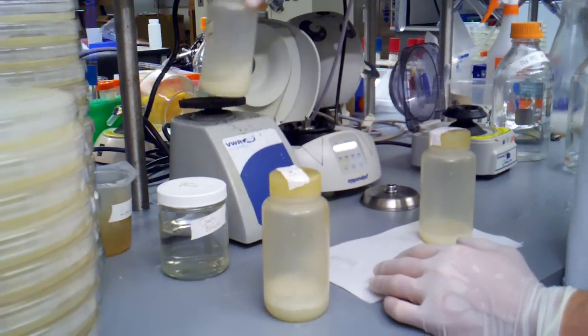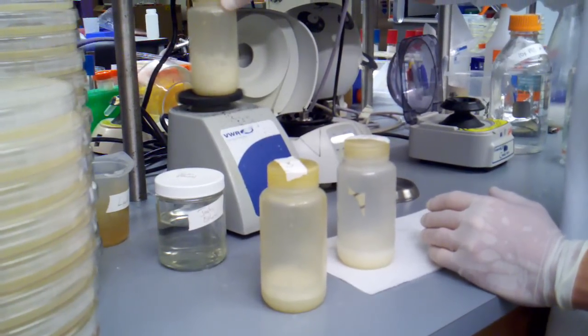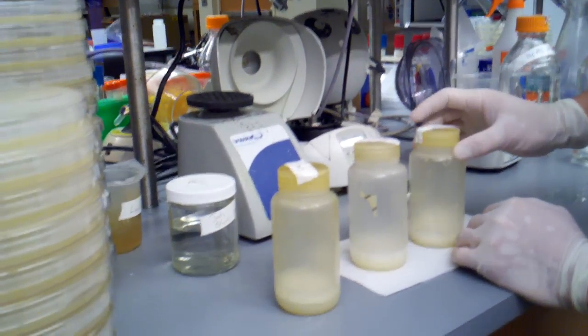And we're going to give these one last vortex just to make sure everything is well mixed. I'm going to give it a little swirl to make sure everything gets down there. And this one was the ugly one, so I'm going to set up the swirl.